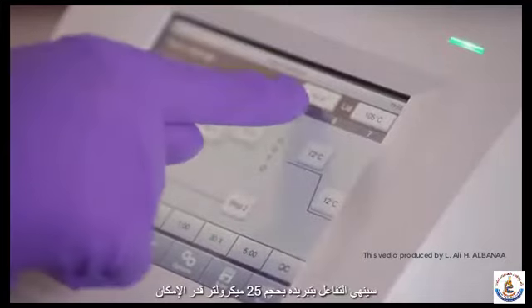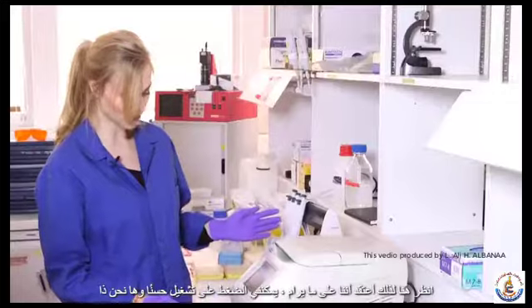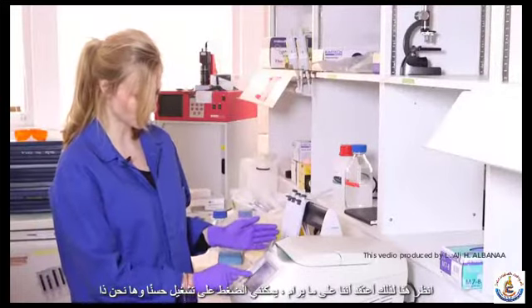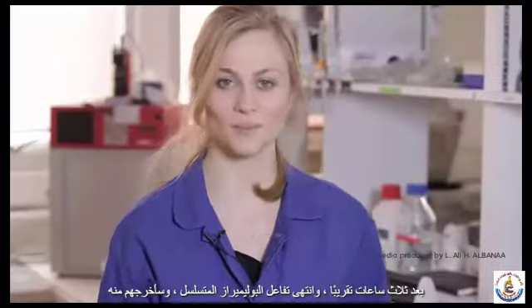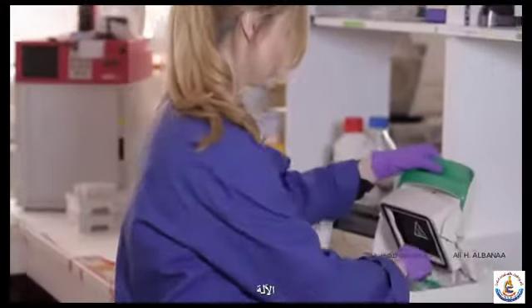My volume is 25 microliters, as you can see here. So I think we're good to go. I can press run. Okay, and there we go. So we're about 3 hours later and our PCR is done. I'm going to take them out of the machine.